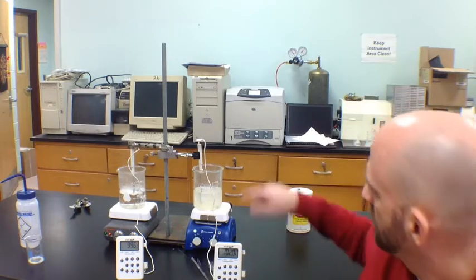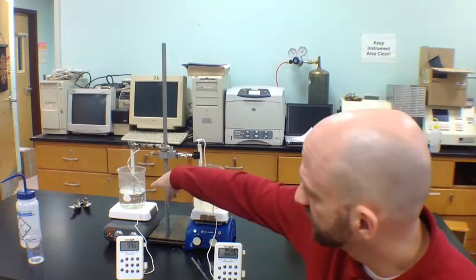The beaker on the right, the one to which I added about 50 grams of table salt, sodium chloride, as you can see, is bubbling about as rigorously as the pure water beaker, so they're both clearly in a boiling condition. But you see here that the temperature is noticeably over 100 degrees. Right now it's reading about 102 degrees Celsius. So what we have here is a phenomenon referred to as boiling point elevation.